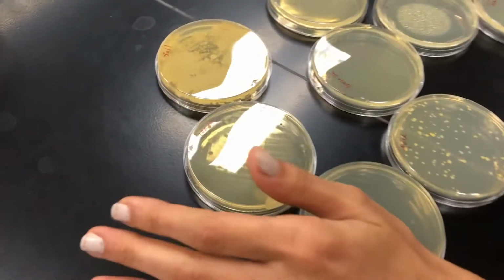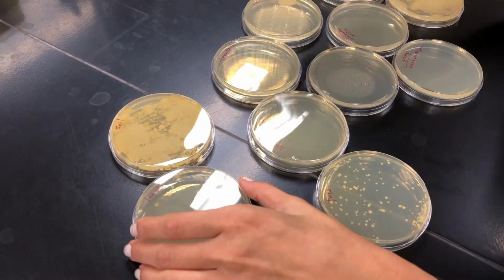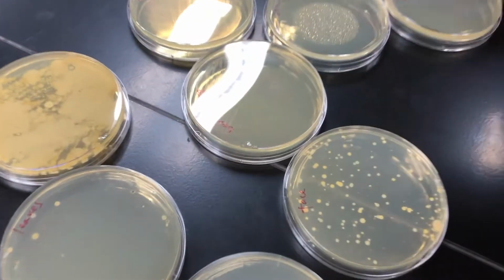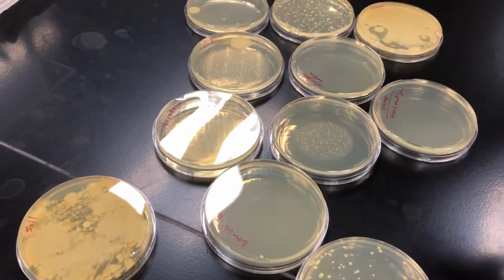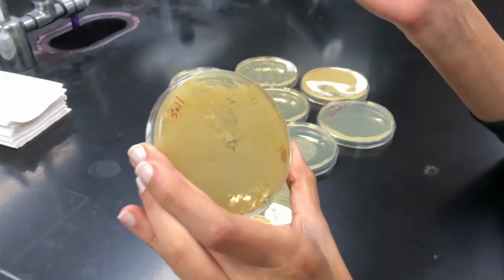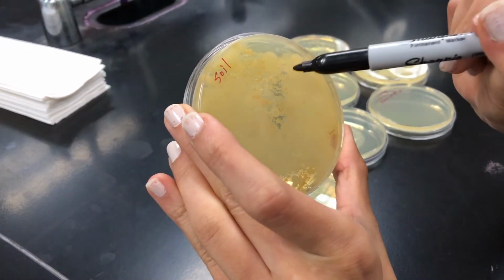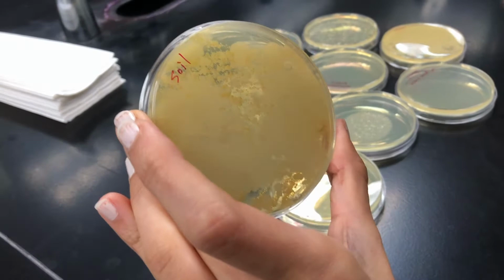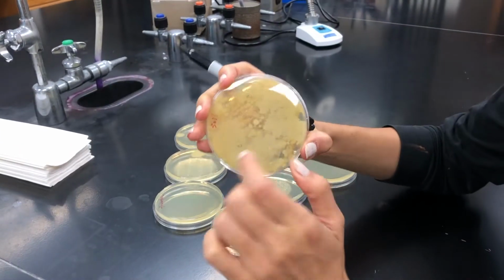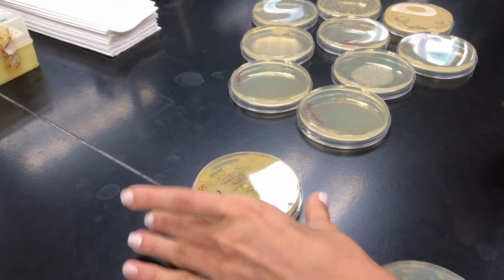We will move to the results. All the TAs grabbed samples from different locations. As you can see: soil, leaves, doorknob, bench top, face, fountain, and we will see the results and discuss them. For example, in soil, you can see a lot of colonies growing all over the plate. Different colonies, you can see 3, even 4 different colonies, and we cannot count them because there are colonies all over the plate. So we can say too many to count.